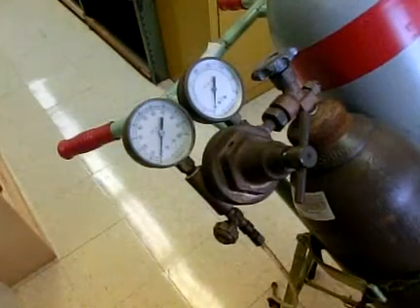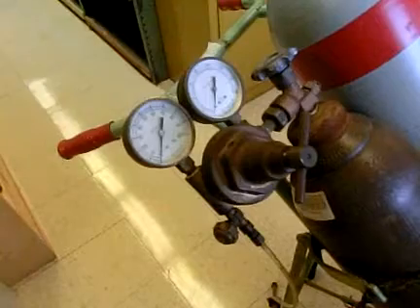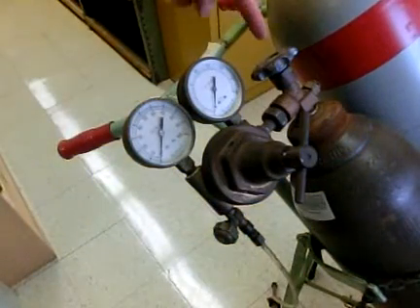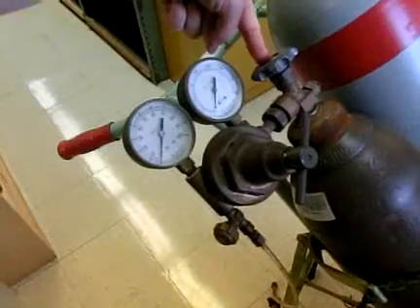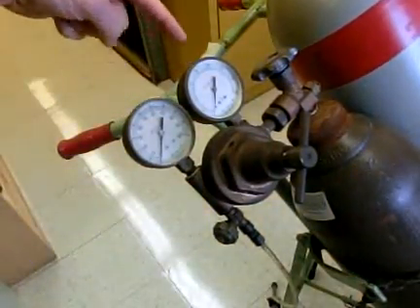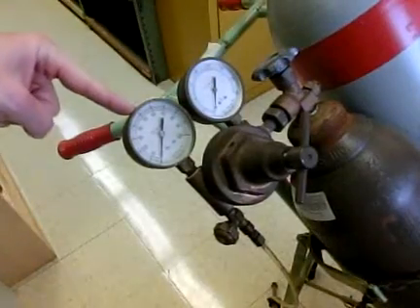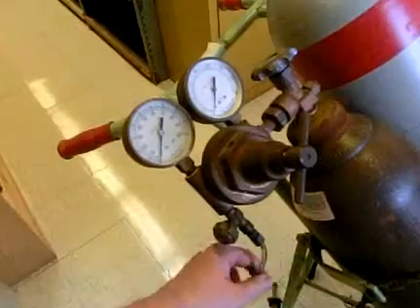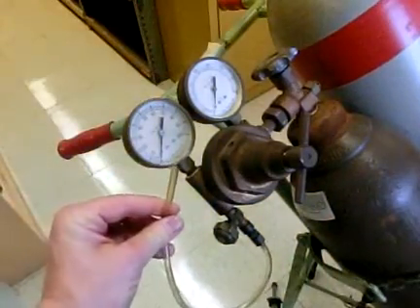This is an introduction to pressurized gas valves and how to take care of them and use them properly. There are three specific valves. This one connects to the tank. This one allows the regulator to work, going from tank pressure down to a pressure you can actually control, and this knob down here will allow you to release gas into whatever device you want, for example a balloon.